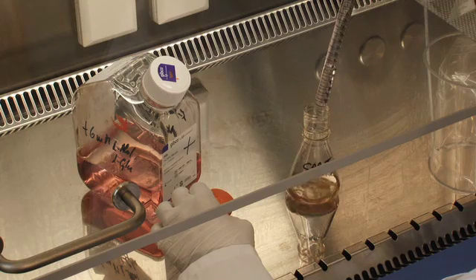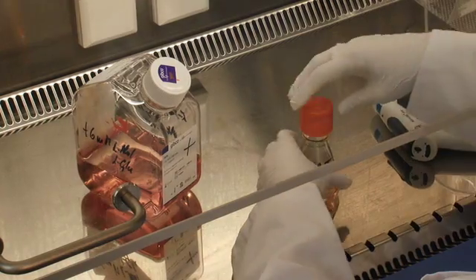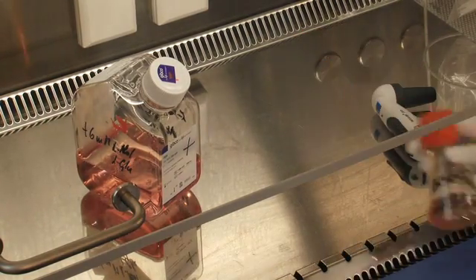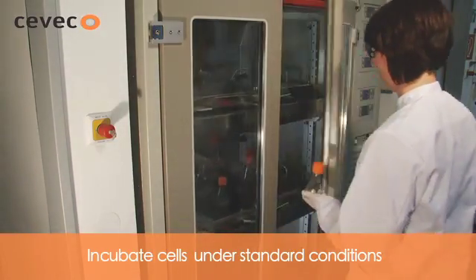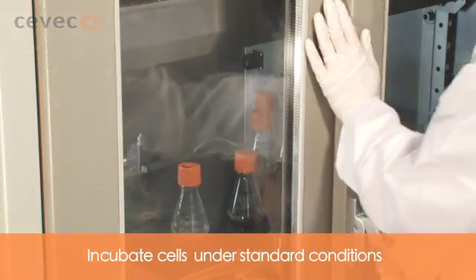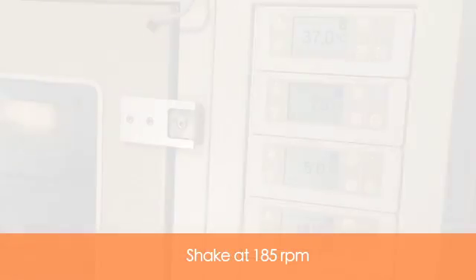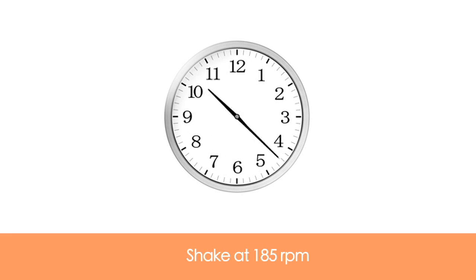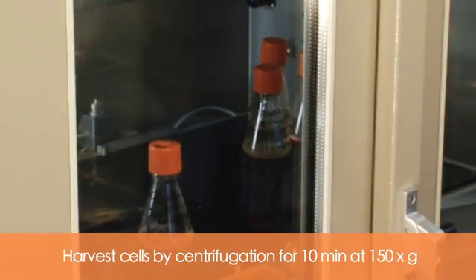For transient expression of up to 7–10 days, no medium change is needed. The optimal harvesting time point depends on the viability of the culture and the stability of the specific product. Incubate the cells under standard conditions, shaking at 185 RPM. Harvest the cells by centrifugation for 10 minutes at 150 g.